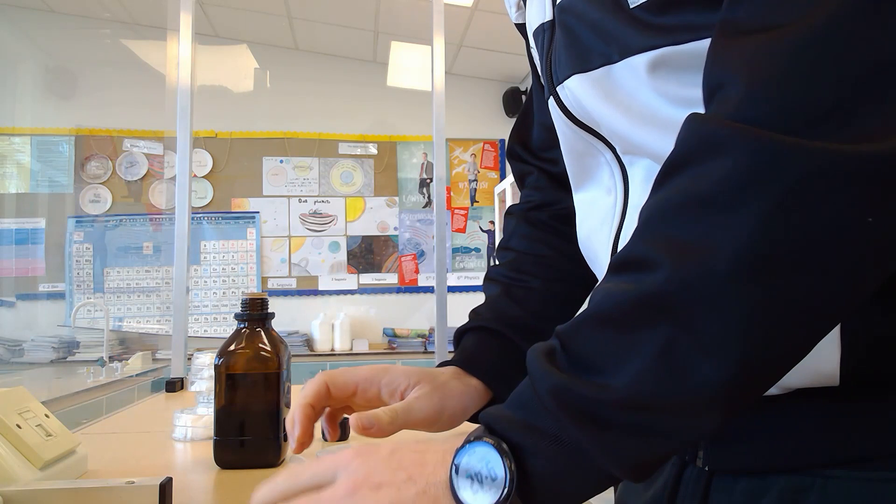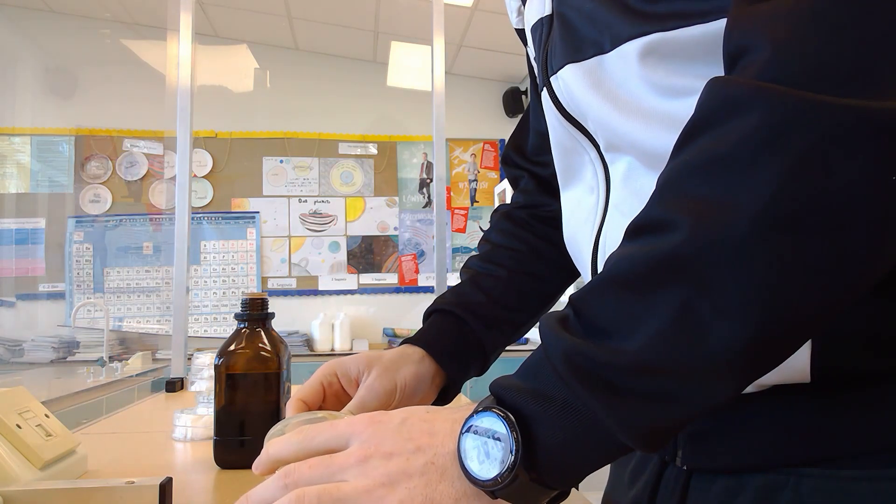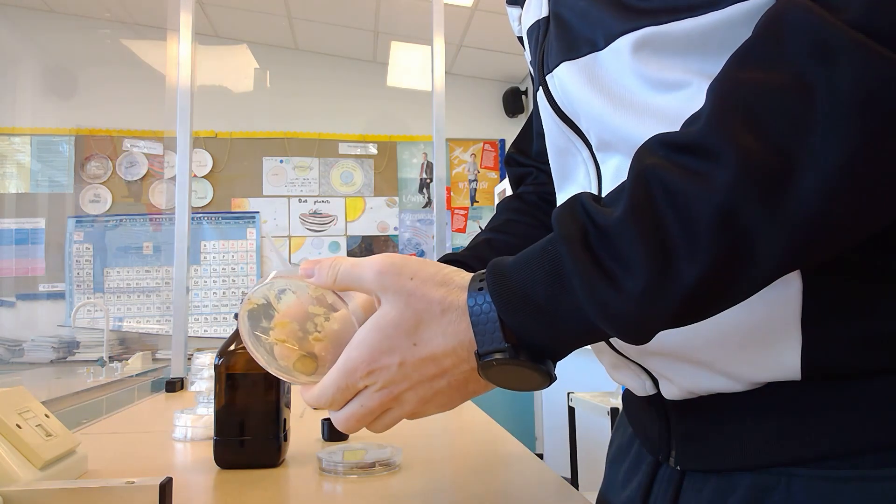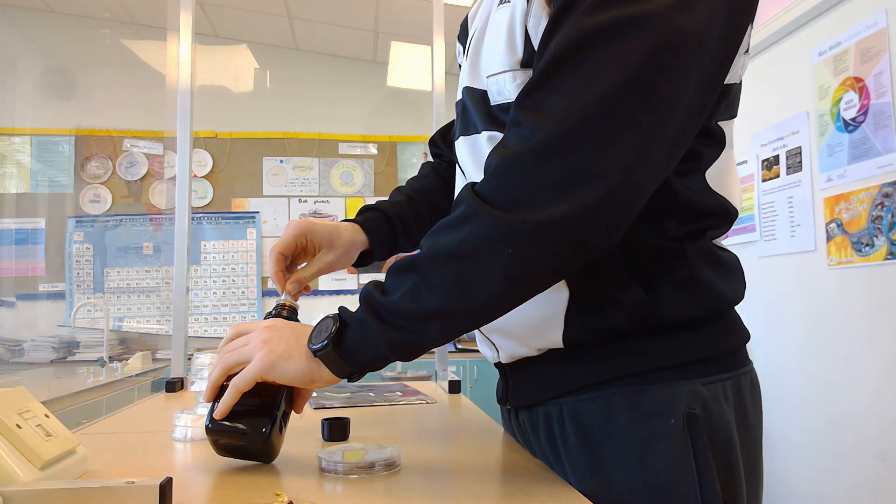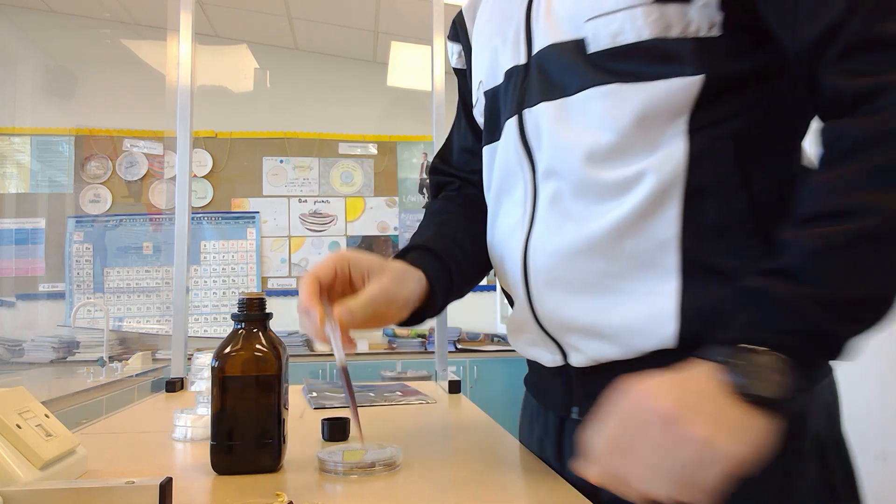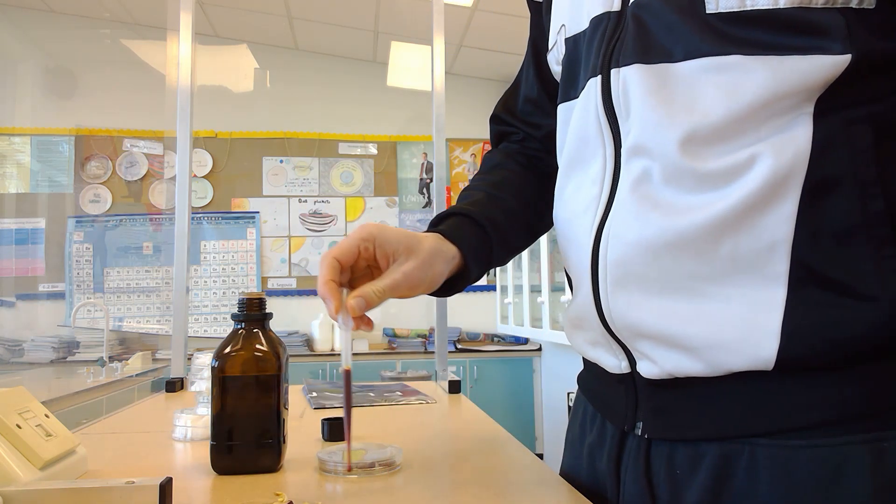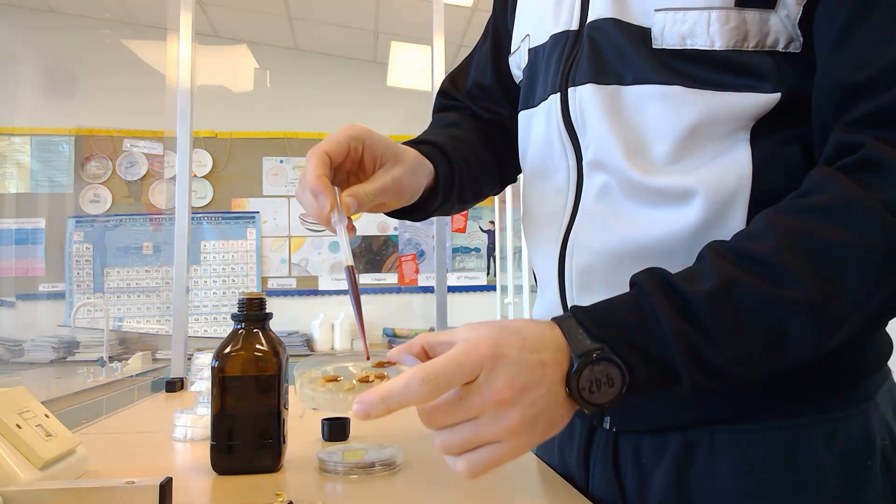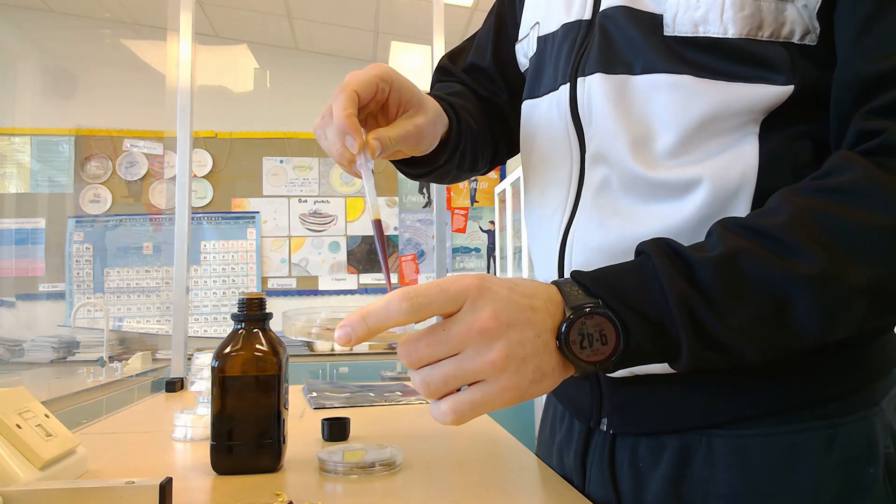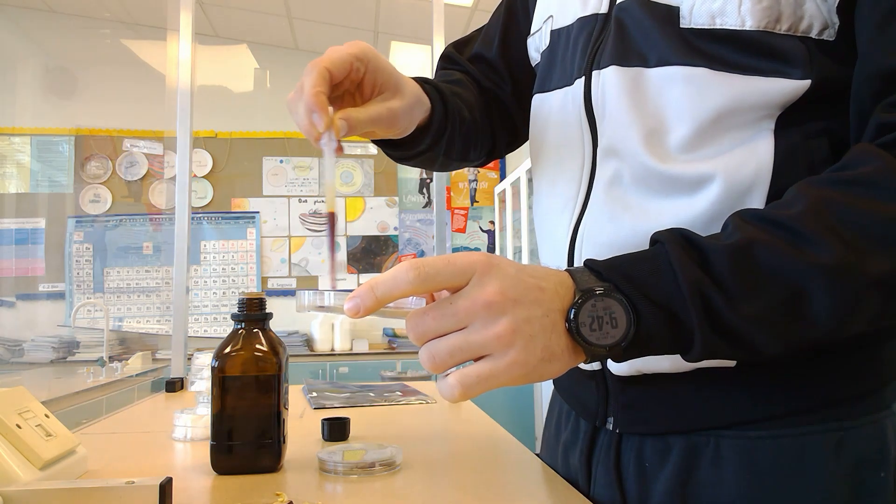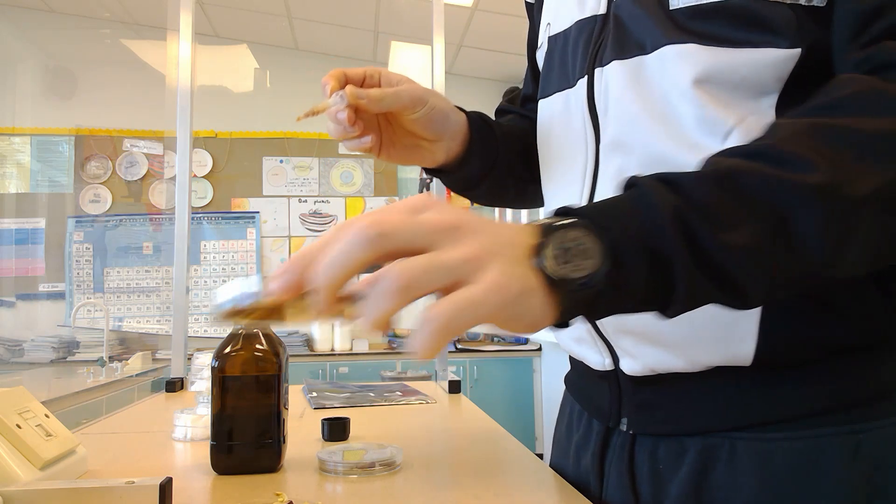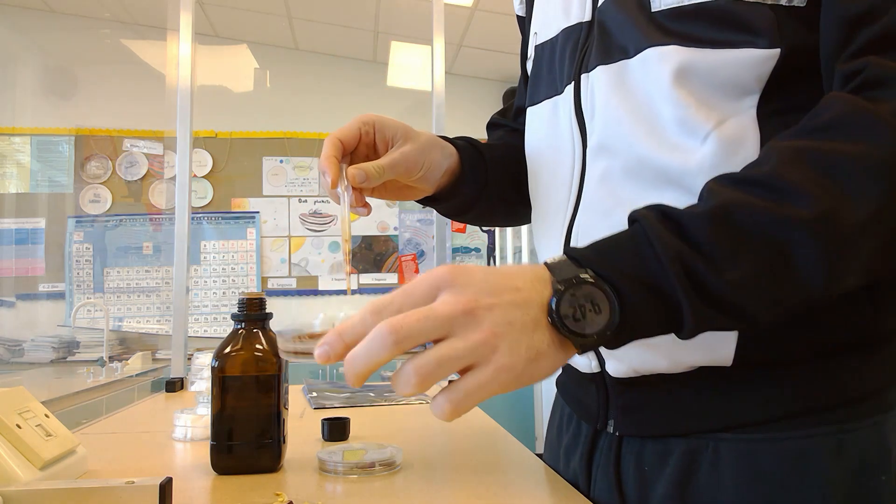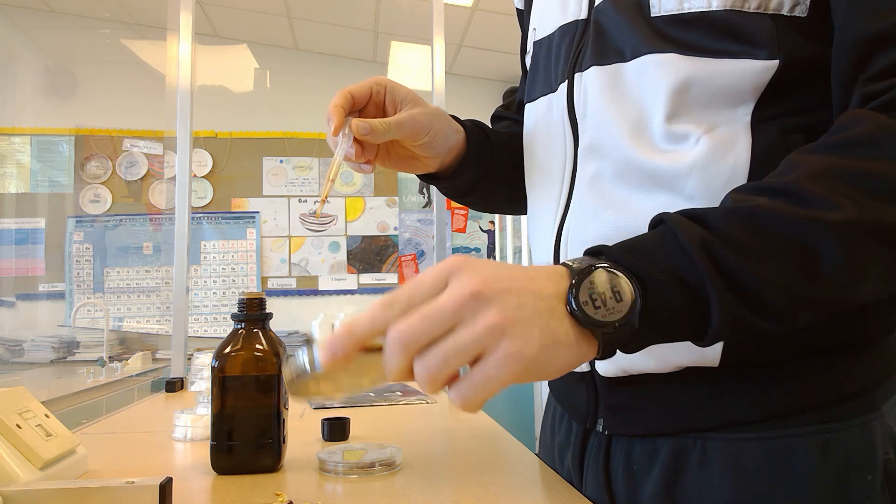I took the experimental plate first, removed all the seeds, then placed drops of iodine onto the plate. I'm looking for clear areas—if areas are completely clear, this shows the seeds digested any starch that was present. The rest of the plate that wasn't under the seeds should be dark, and you can see a few clear areas. It's not as clear as we'd like, but you can still see them.